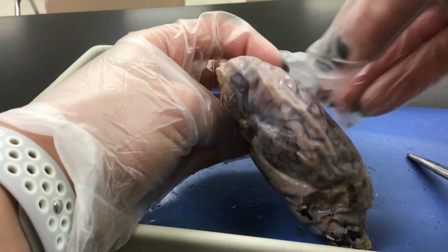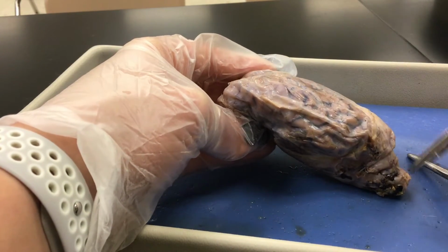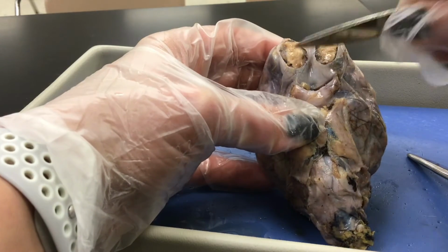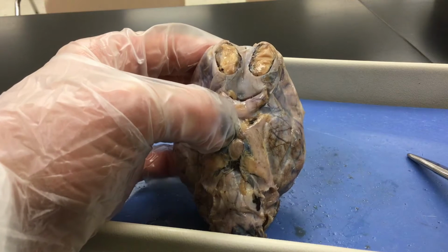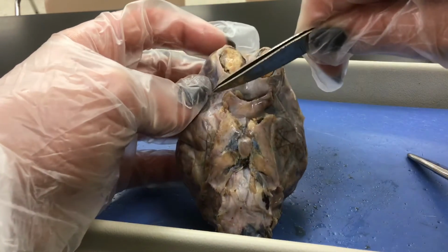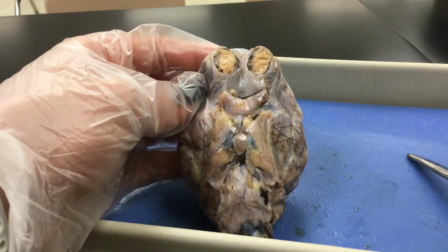Starting with, if we get our orientation figured out here, this is going to be the brainstem, so this is the front, or where the frontal lobe would be. And if we turn it over, these two distinct features are going to be the olfactory bulbs. Those receive input of odors found in the nasal cavity. Next, we have this horseshoe looking thing right here. That's going to be the optic chiasm, and that connects the retinal fibers to the optic tracts.